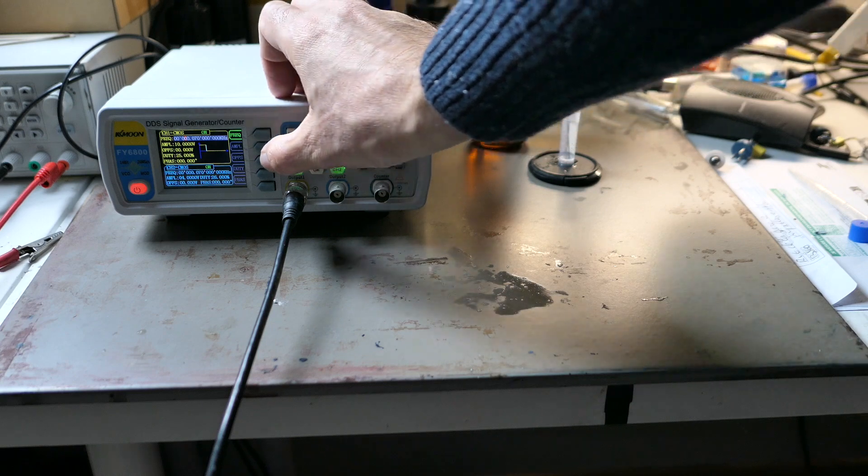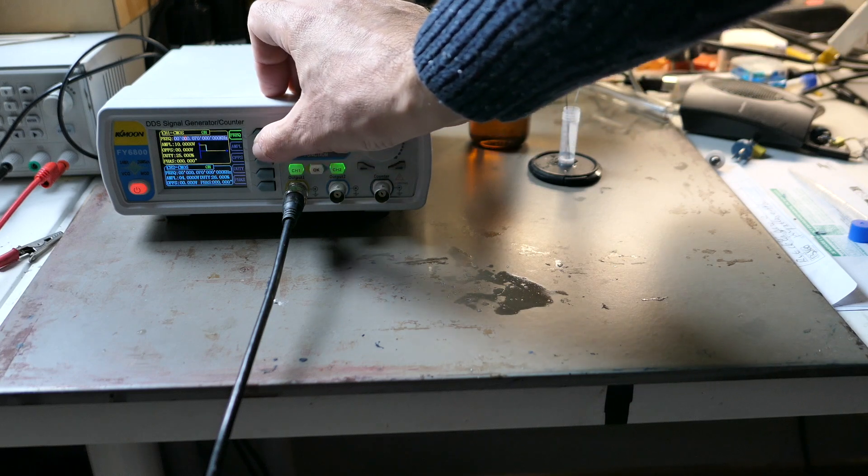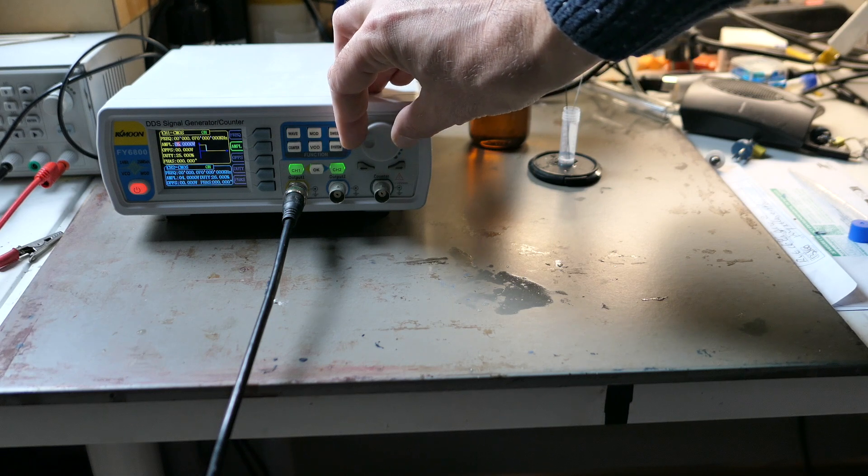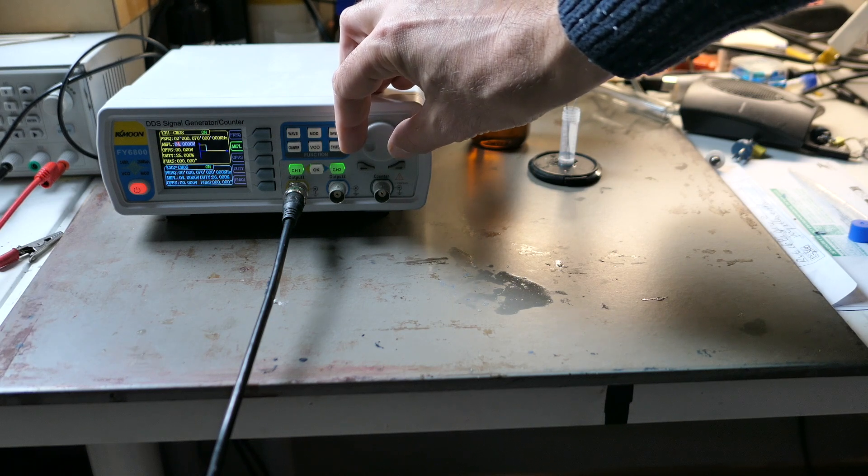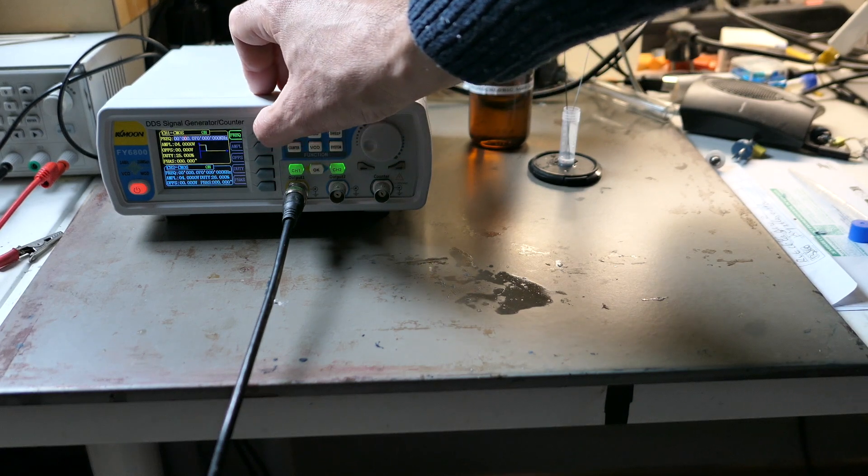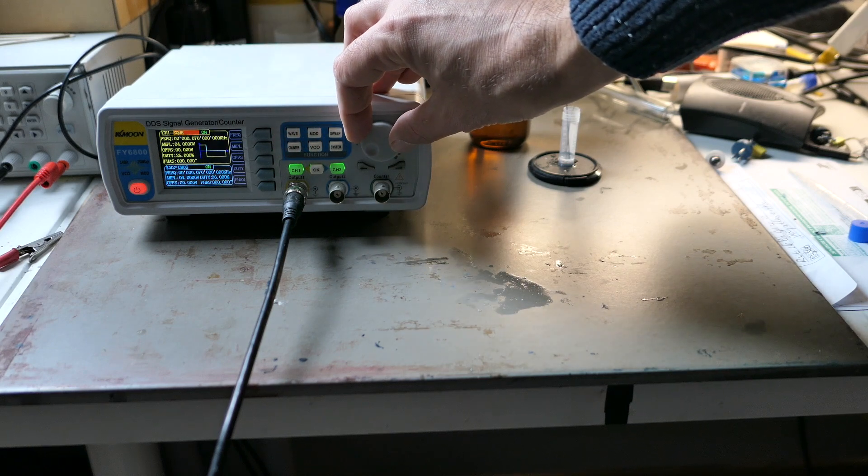To achieve this I'll be using a low frequency signal generator and applying a square wave. With this setup we're breaking away from the traditional concept of a distinct cathode and anode since the alternating current means the roles of the electrodes are constantly switching.